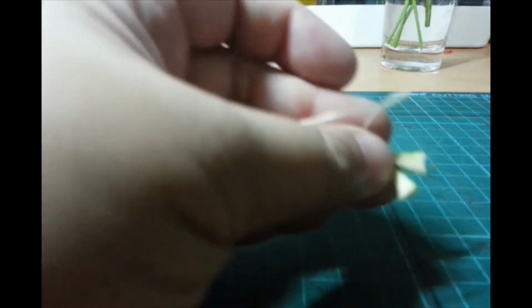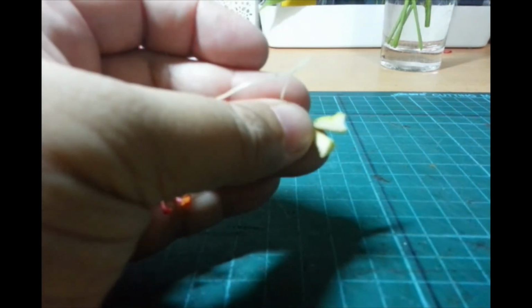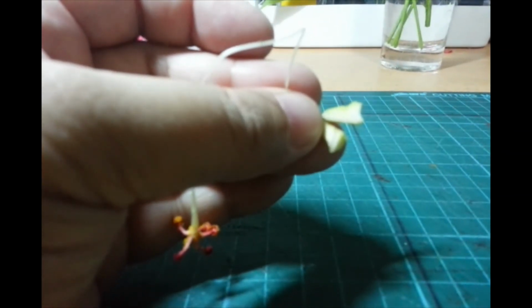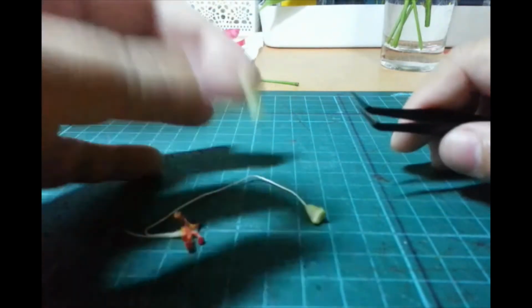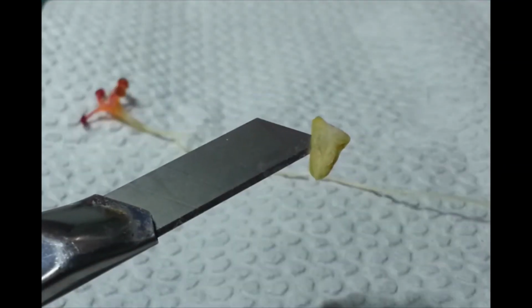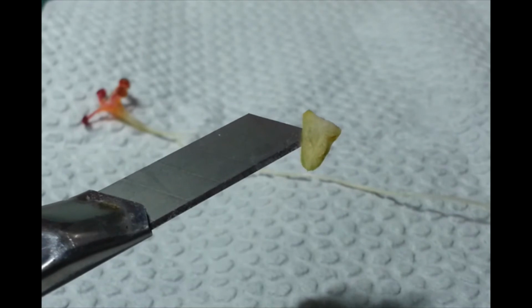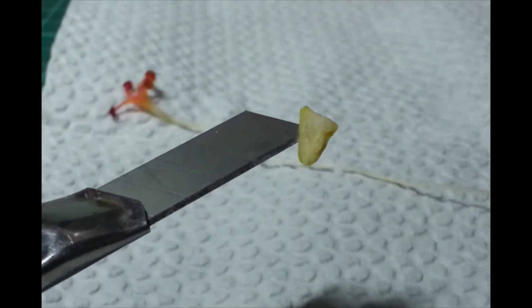Still too bright. Ayaw mag-focus. Okay. Ovule. Oh no. Sige. Ayan. Oops. Okay. Sorry about that. I knocked over the camera and then stopped filming.